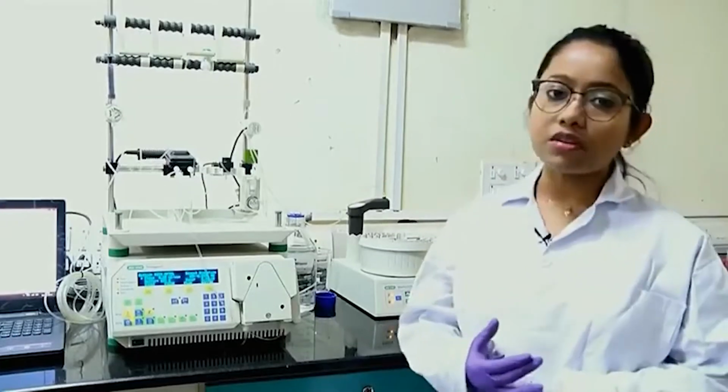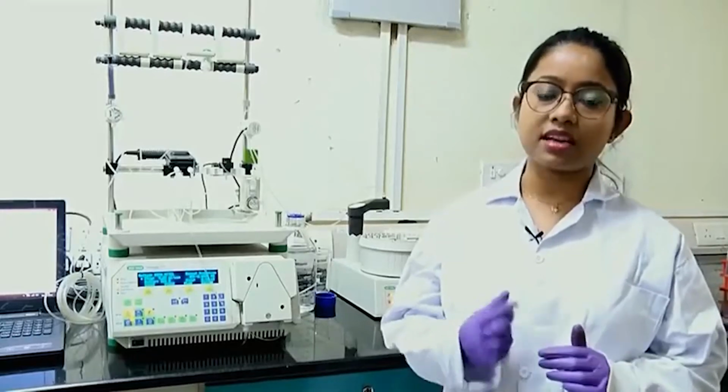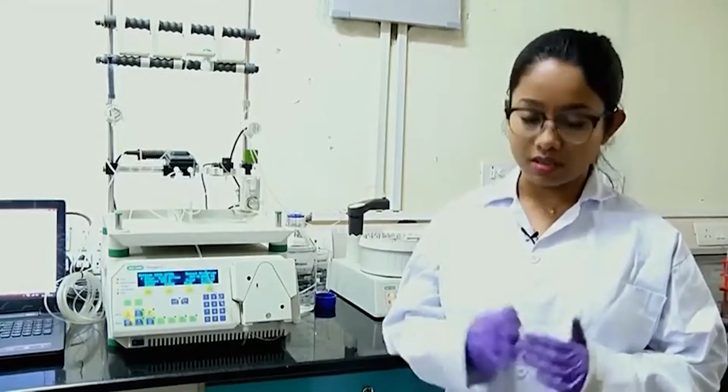So, now I have a protein which has a 6x histidine tag. That means 6 histidine molecules are present consecutively at the N terminal of the protein. So, this 6 histidine tagged protein will help me to isolate this particular protein from other contaminant proteins from the cell lysate which do not have this consecutive histidine tag.